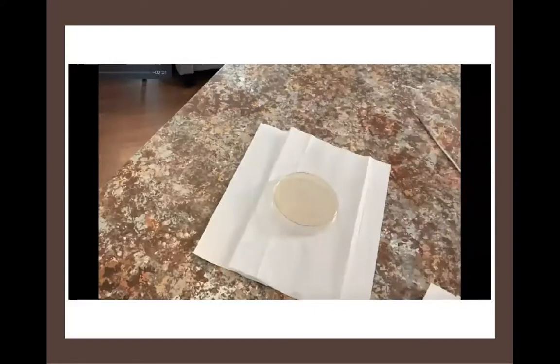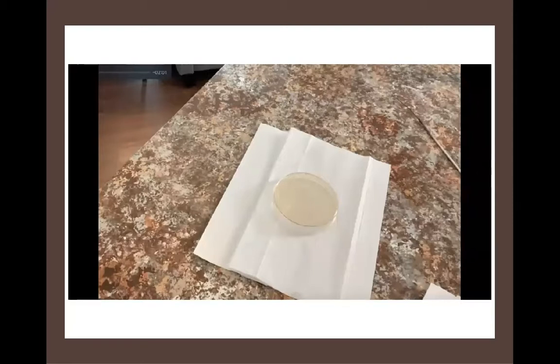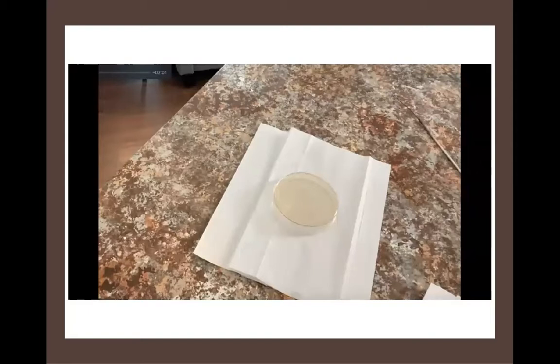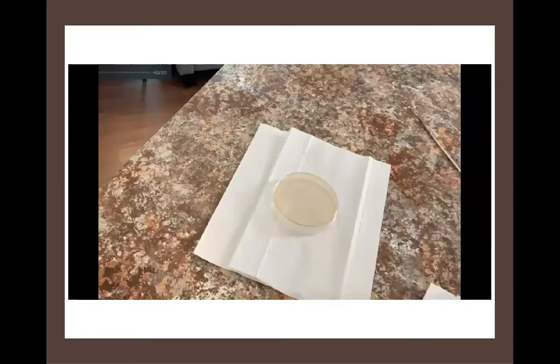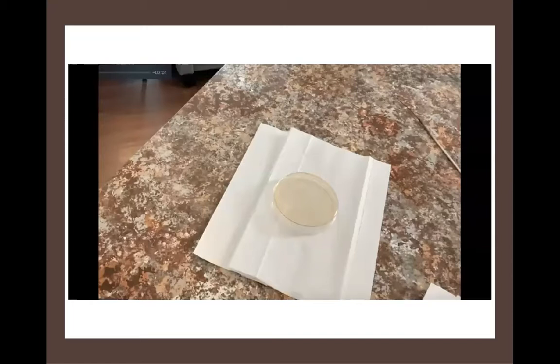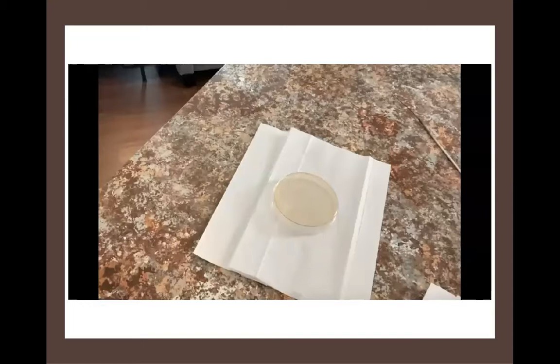We handle agar plates upside down. We put agar plates into the incubator upside down so that the agar — the solid media — is at the very top once inverted. This allows any condensation that develops inside the warm incubator to drip off the surface of the agar and onto the lid of the plate, rather than interfering with the growth of bacterial cells on the agar surface. So we handle them upside down: open and close them upside down, and place them into the incubator upside down.